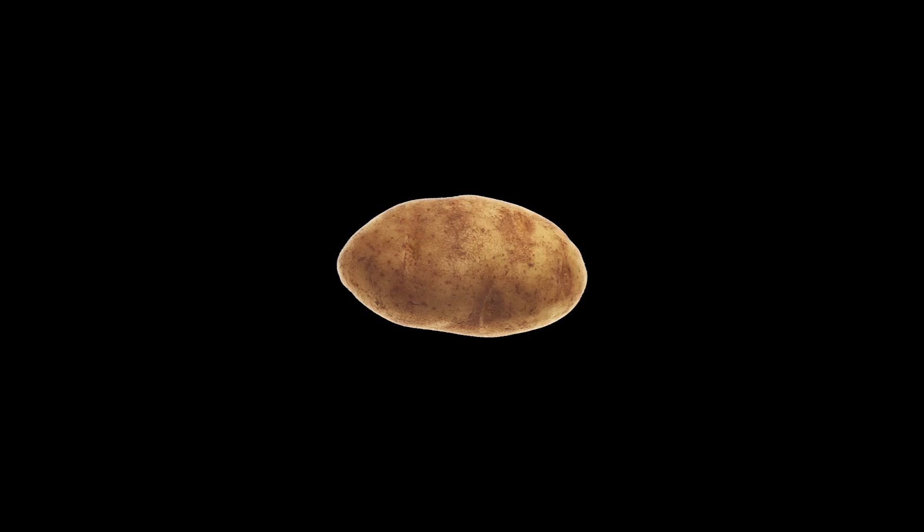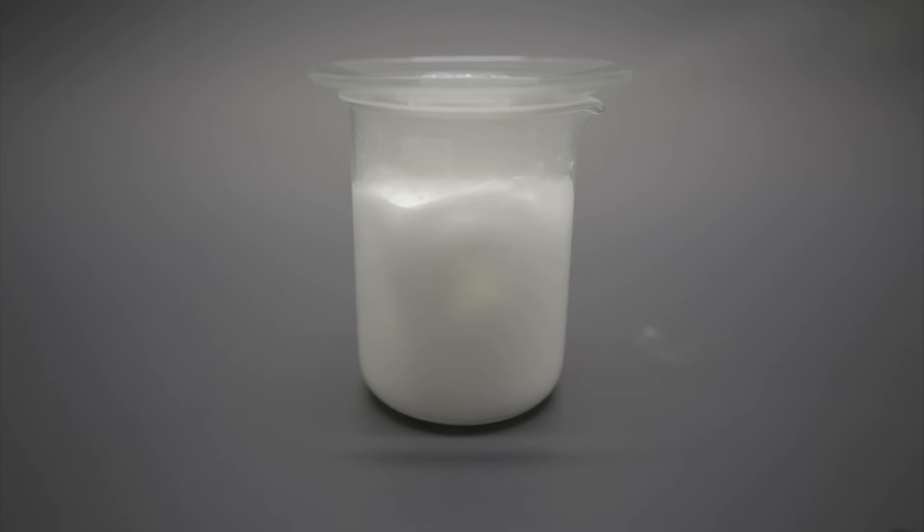There's actually a small smattering of videos and images of this reaction, but as far as I could tell, most of them are recorded with a potato, and I've always wanted to see it in high def. This is a reaction I've wanted to try for a really long time, but the only reason I'm doing it now is because I can use Nile's fume hood, as it's just not safe to do otherwise. So don't attempt this unless you have one, it's not safe to do outside.